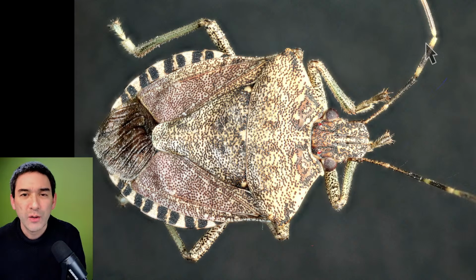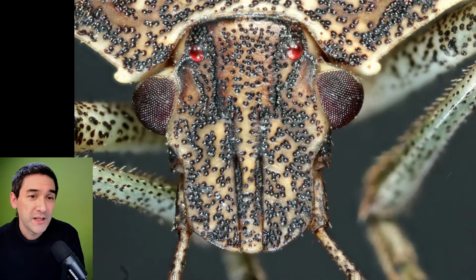I just want to show you how you can distinguish beetles from bugs. Do you see this back part here? It's kind of transparent. That's basically the lower part of the wing, which is membranous. Beetles have a full cover; the front wing is all solid all the way back. But bugs, like this one, have the lower part of the wing transparent, like a membrane. That's why they belong to the so-called Heteroptera. And also very nice, look at this. Here you can also see the compound eyes quite nicely. Thank you very much for the pictures.